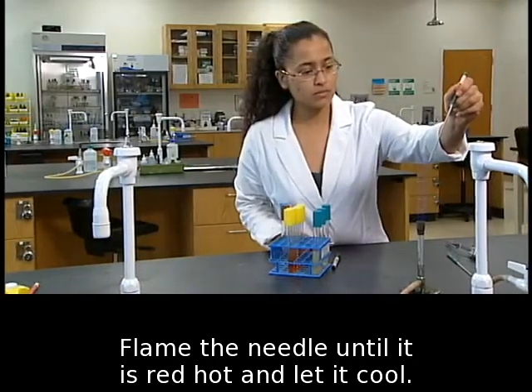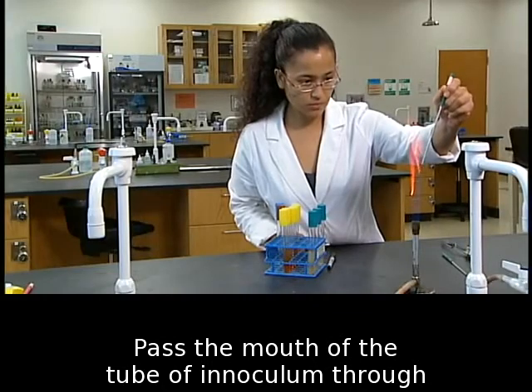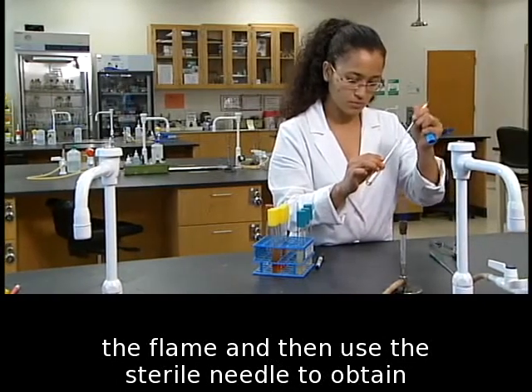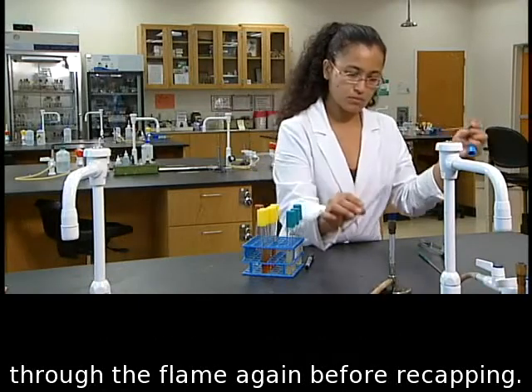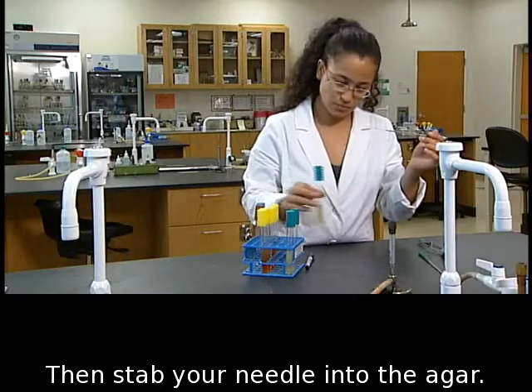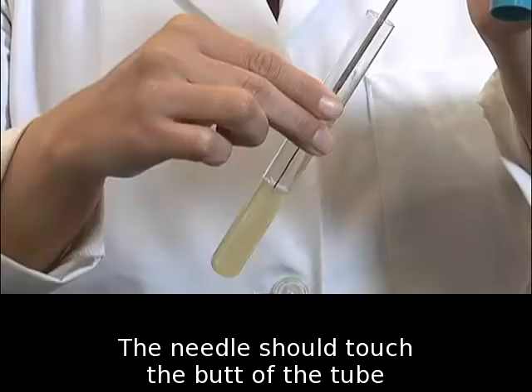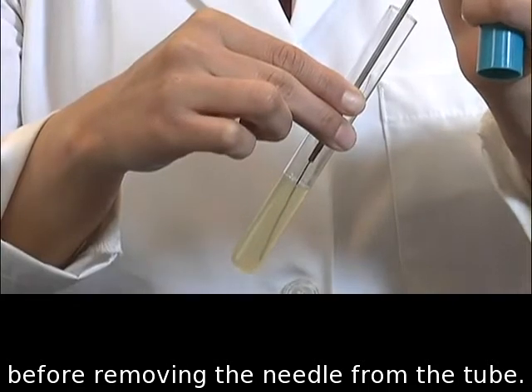Flame the needle until it is red hot and let it cool. Pass the mouth of the tube of inoculum through the flame and then use the sterile needle to obtain some inoculum. Remember to pass the tube through the flame again before recapping. Then, stab your needle into the agar. The needle should touch the butt of the tube before removing the needle from the tube.